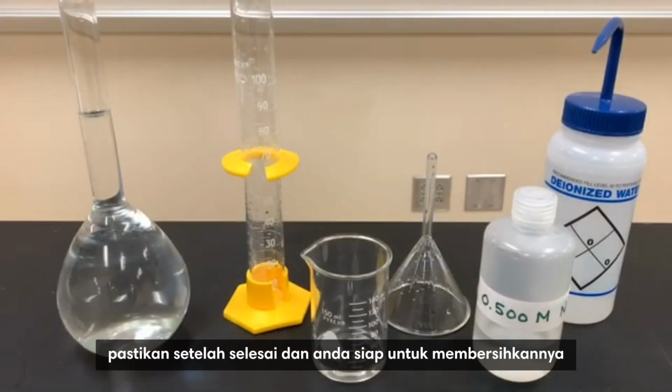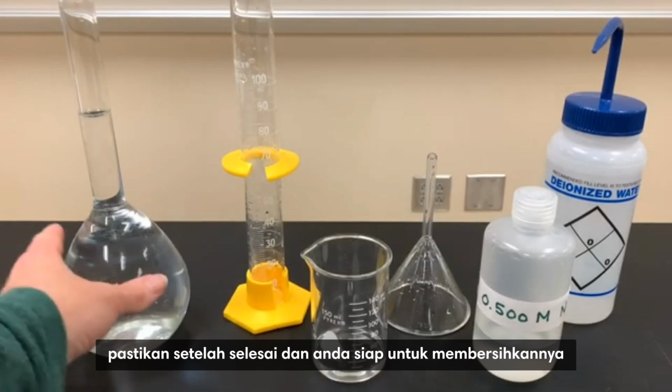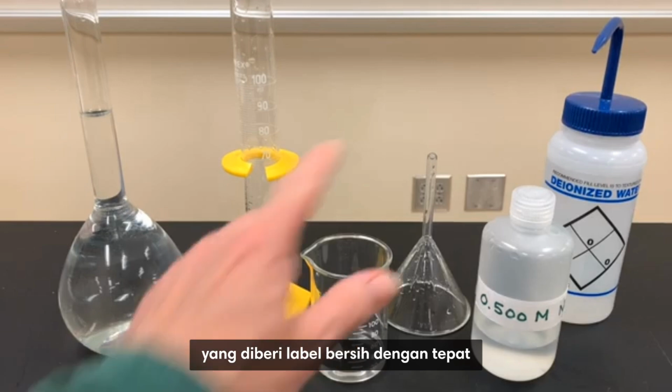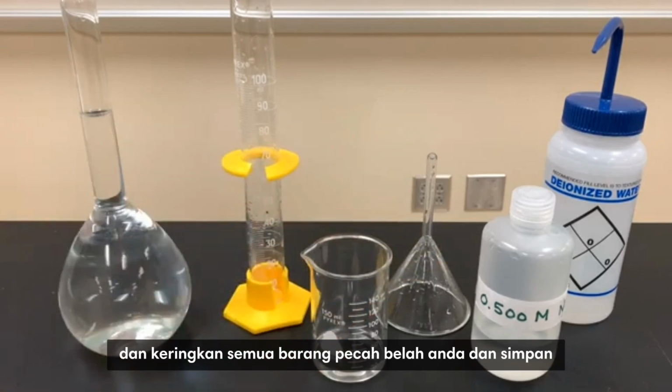sodium chloride. Make sure when you're done and you're ready to clean up that you transfer your solution to a new stock bottle that's appropriately labeled. Clean and dry all your glassware and put it away.